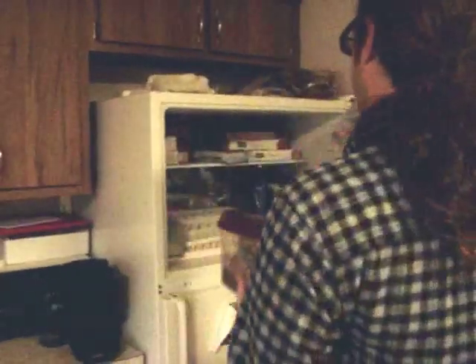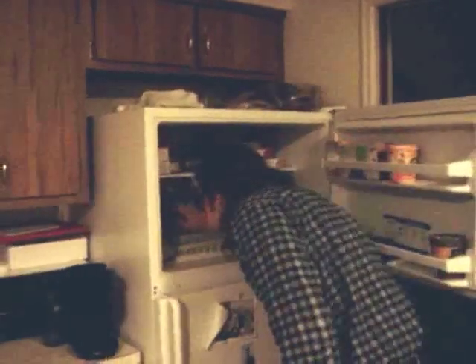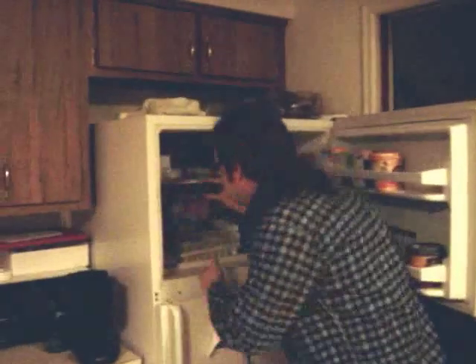But how do you do it? Let's show you. Take the humble discoid cockroach, put it in the box, and place it in the anesthesiology wing of your house. Wait about 10 minutes, take them out, and take them back to your neuroscience lab upstairs.